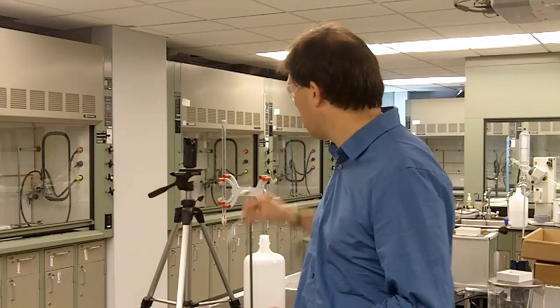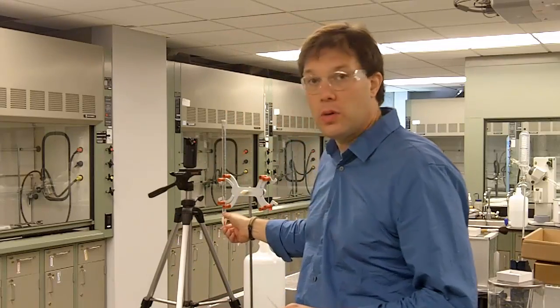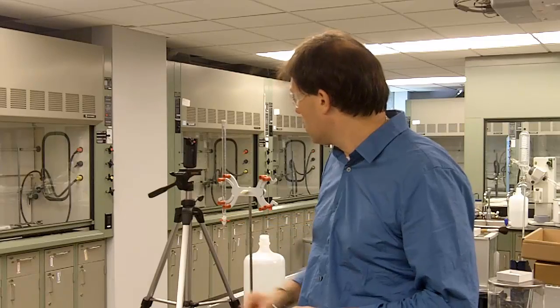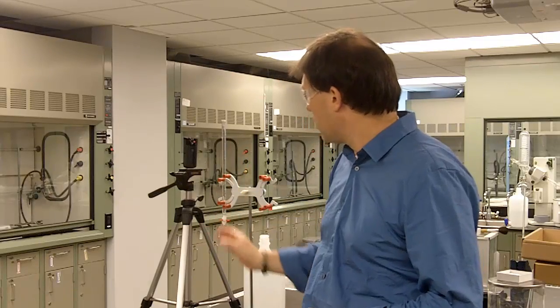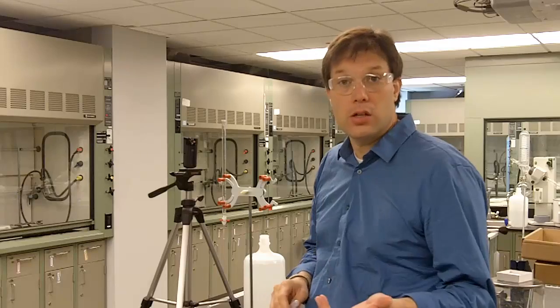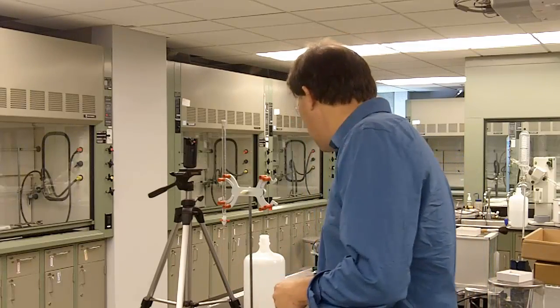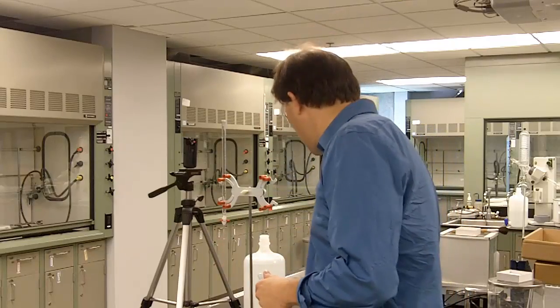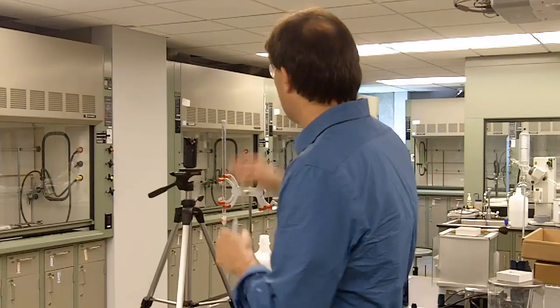So we have the burette here on the burette clamp and the first thing you always want to do is make sure that it is closed. This perpendicular to the burette is closed, so that you need to do before adding anything otherwise it is just going to shoot right through and spill all over the place.